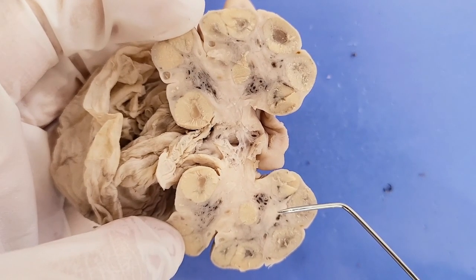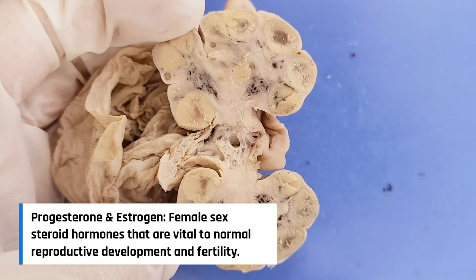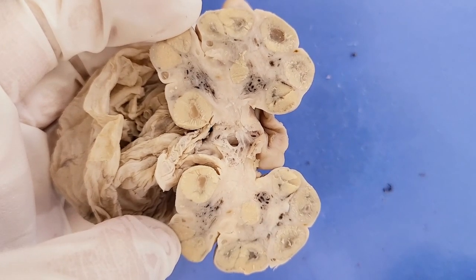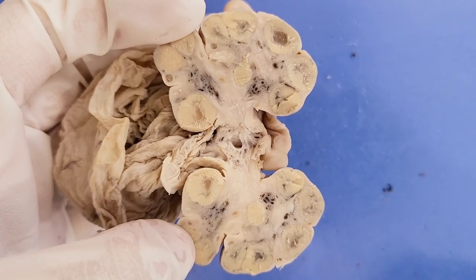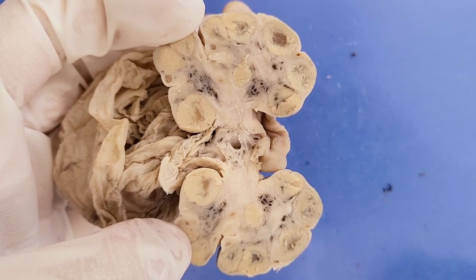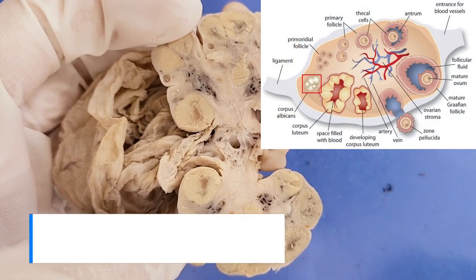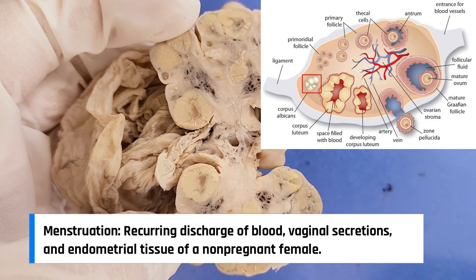The corpus luteum functions in producing hormones — it produces a massive amount of progesterone and estrogen. The progesterone secreted by the corpus luteum is essential for establishing and maintaining pregnancy if the egg is fertilized. However, if the egg is not fertilized, the corpus luteum degenerates, which signals menstruation and the beginning of a new ovulatory cycle.